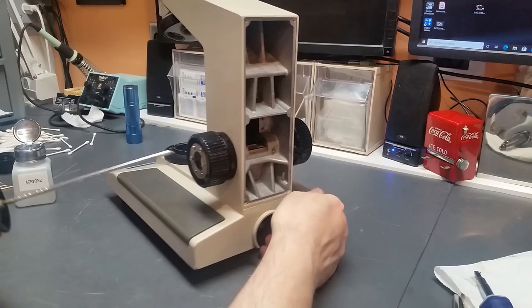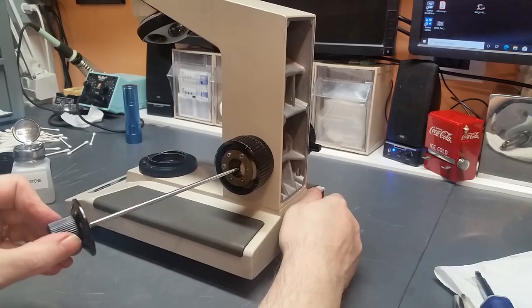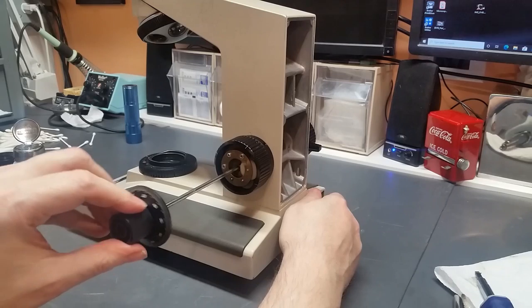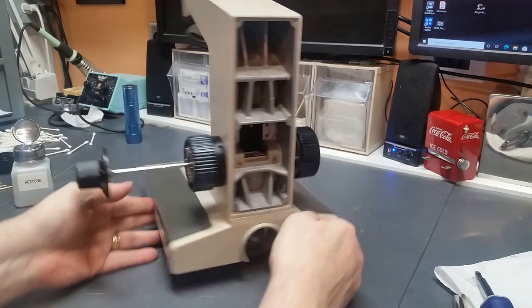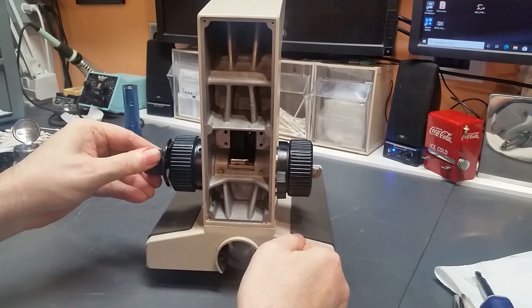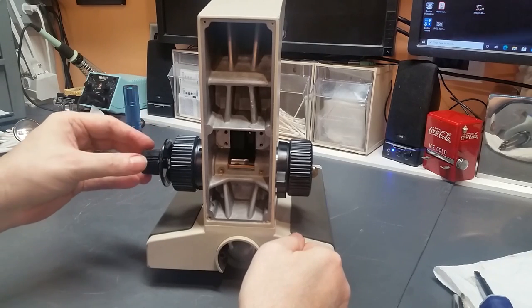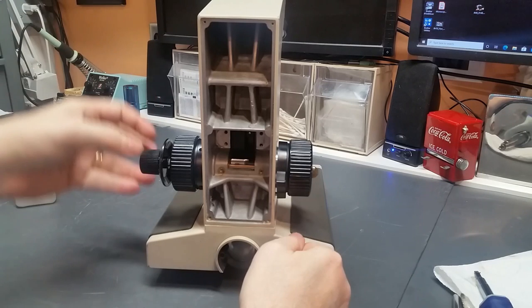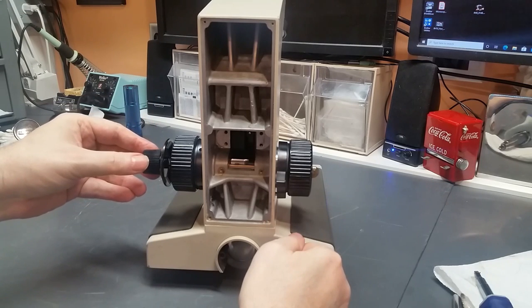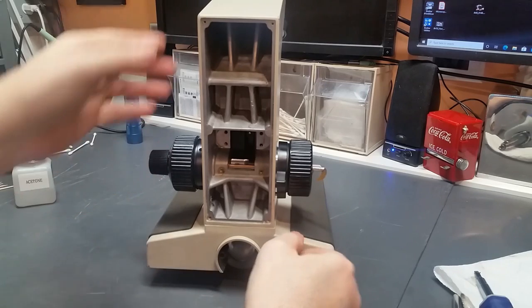So anyway, I'm going to put the shaft into the bore, push it in, and when it gets to the end here, I want to be careful. I want to push it straight in and move it a little bit so that that little gear inside the knob meshes with the plastic gear inside there without being damaged. So a little bit of finesse is required there.